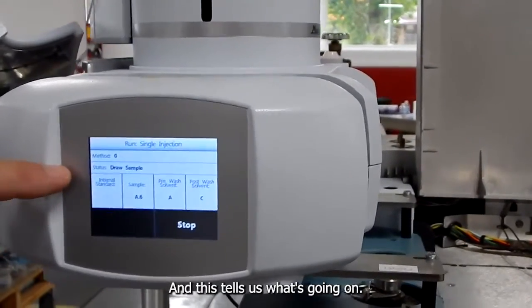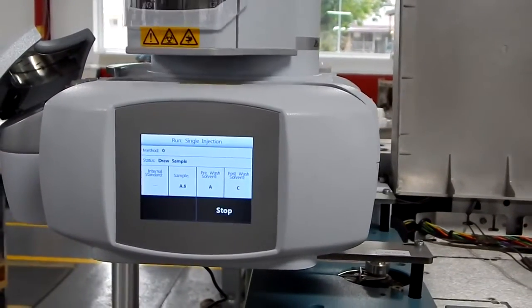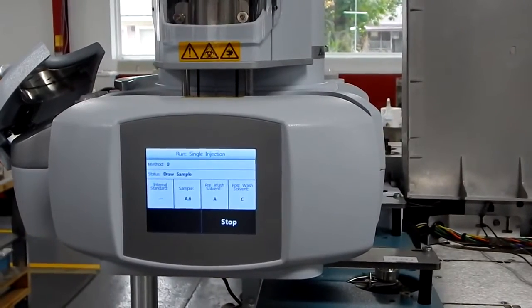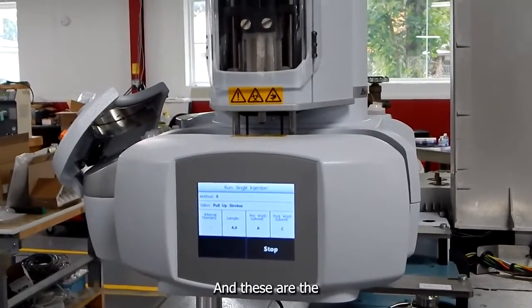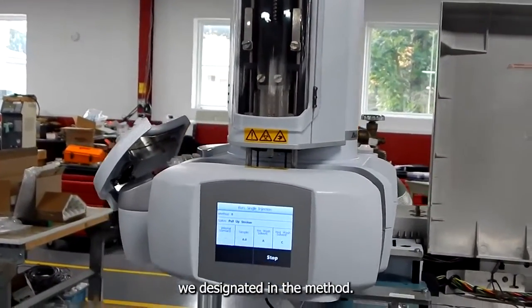And this tells us what's going on. And these are the 5 pumps that we designated in the method.